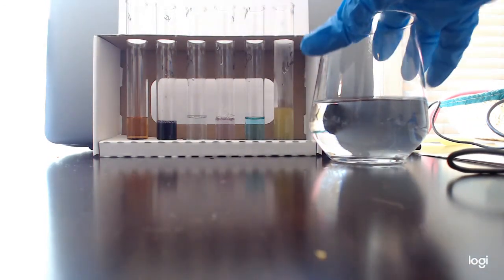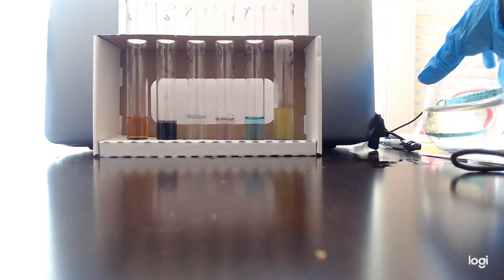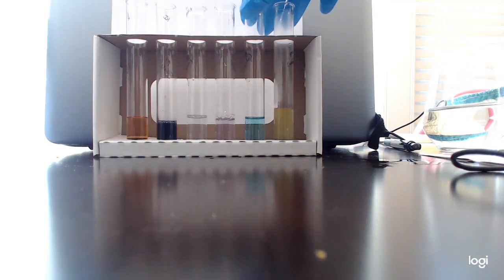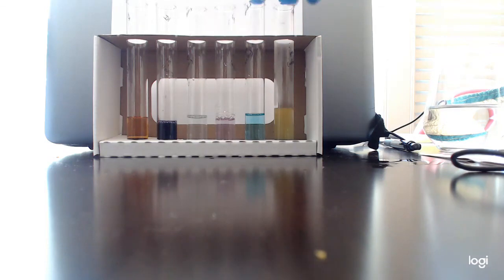Those are going to be your three positive controls: negative and positive for starch, negative and positive for protein, negative and positive for sugar. Don't forget that this Benedict test requires a little bit of heat, otherwise it doesn't work, as you guys watched me do. All right, thanks. Hang on tight, and then I'll do the tests for the other foodstuffs. Bye.